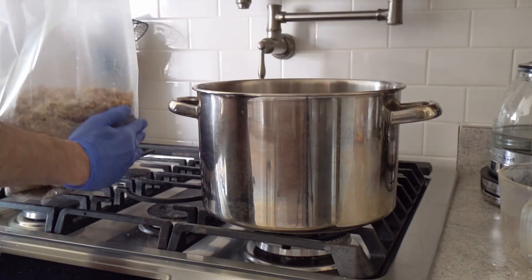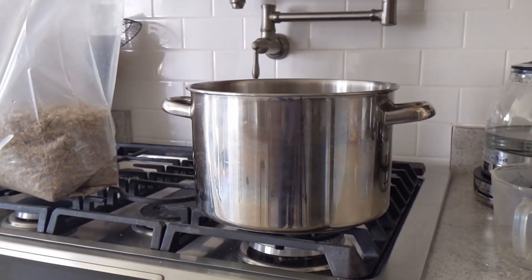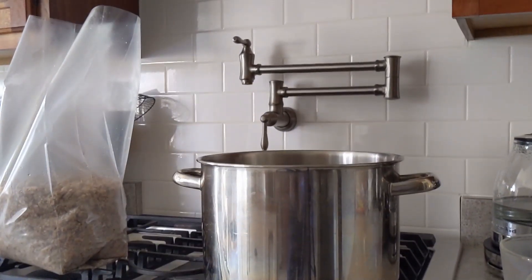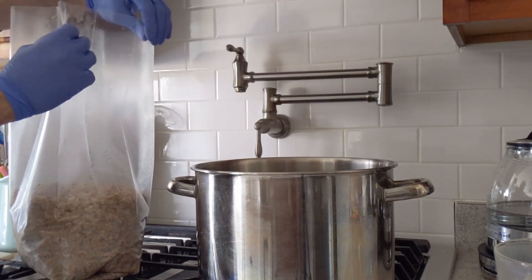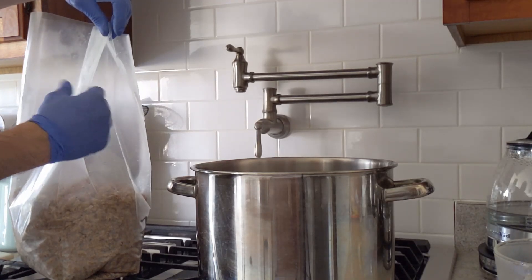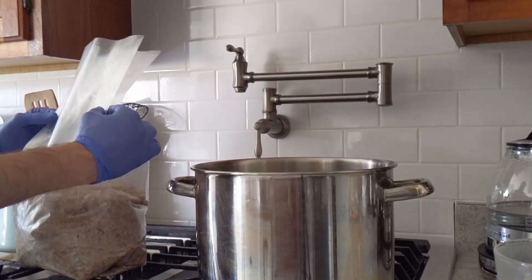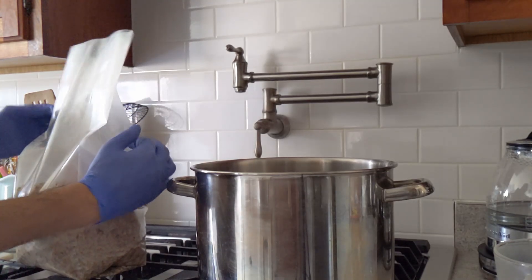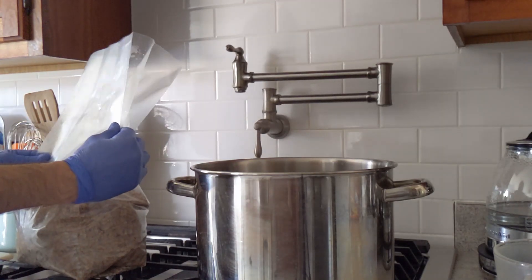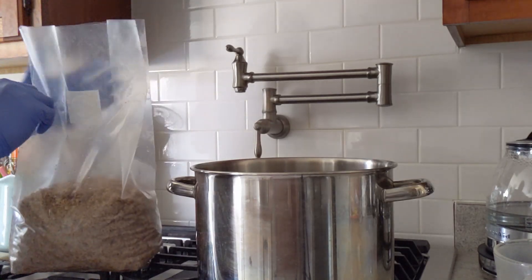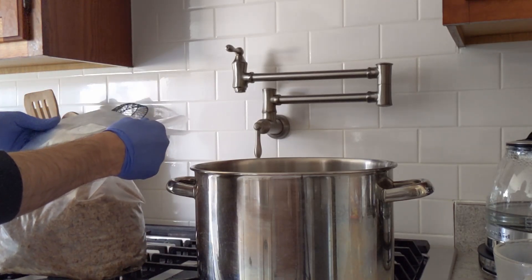I'm going to close them up to the corners, kind of line them up. I like to go down the seam and kind of keep this lined as far down as I can. I'll kind of put the crease in and I'll do that for the other side as well. I also like to have the filter patch facing me when I do this.